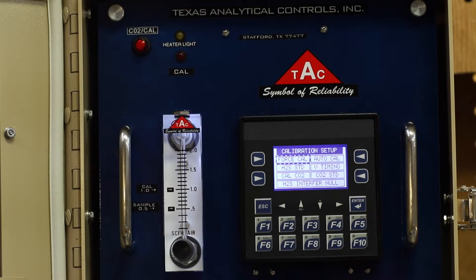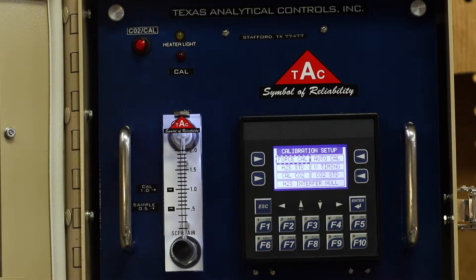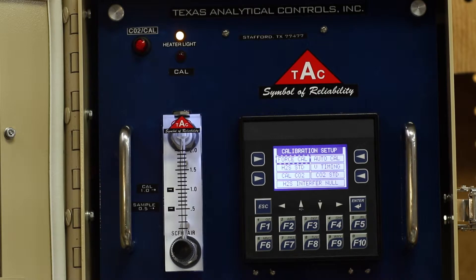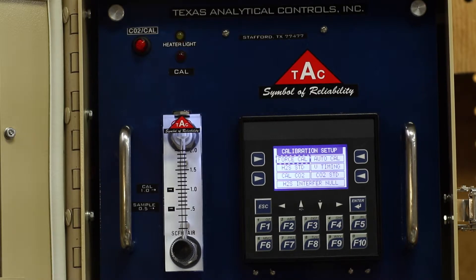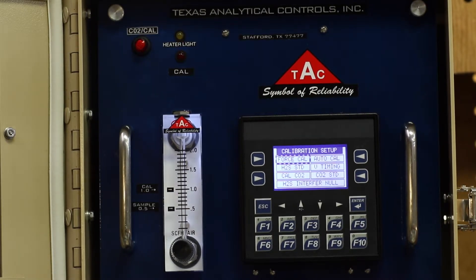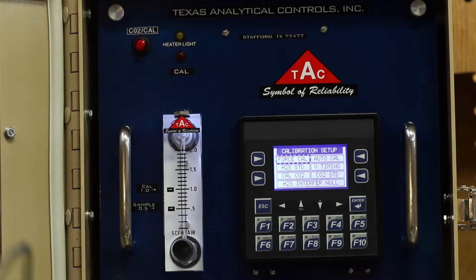Calibration is very simple. You will need one bottle of nitrogen and one bottle of CO2. First of all, we want to make sure that the correct CO2 standard has been entered into the controller.